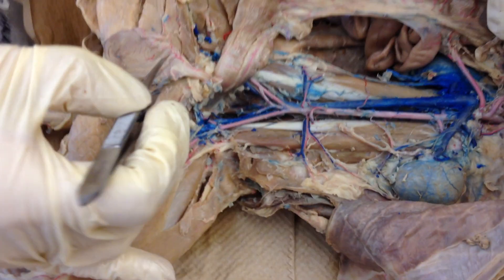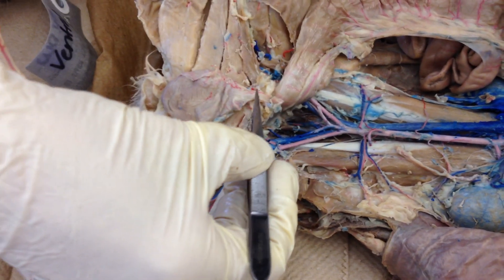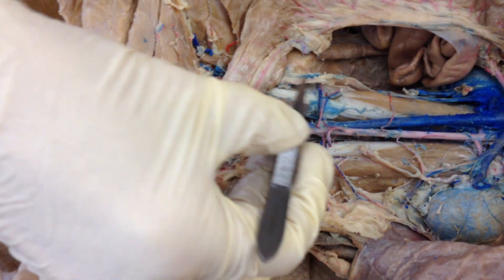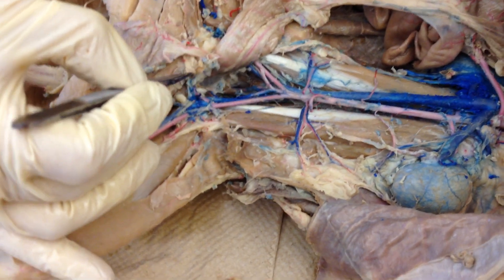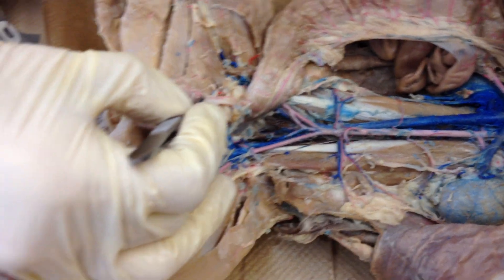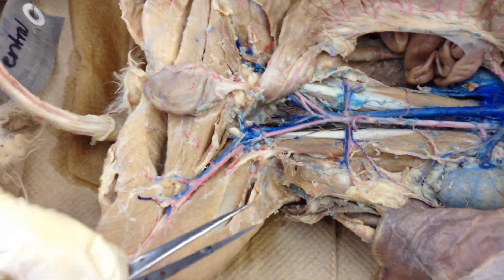Also notice here we've got the urinary bladder and here's the urethra. This is the ureter — it kind of goes from the kidney. This ureter has been broken here but it comes right down and hooks up to the bottom of the bladder. Here's the ureter on this side — it hooks up to the bottom of the bladder, and then there's the urethra where it exits the body.